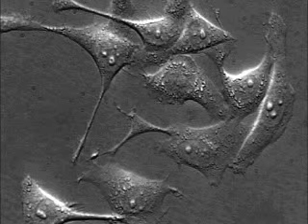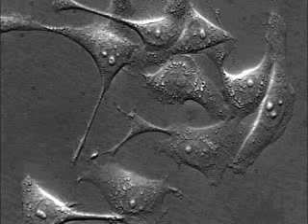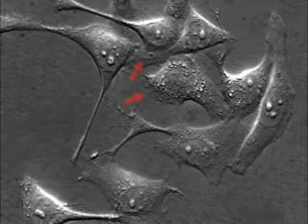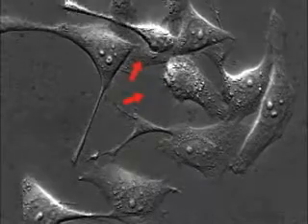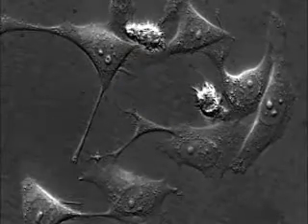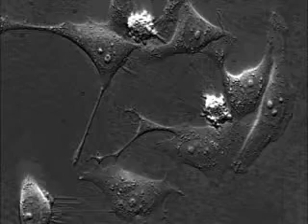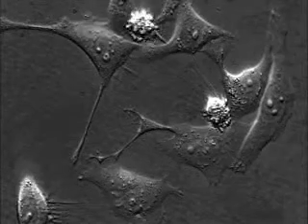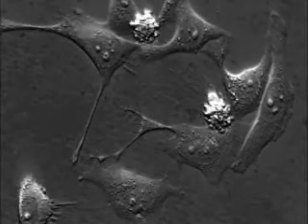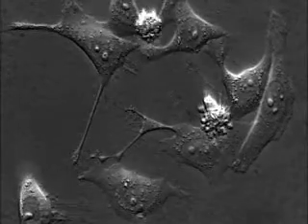Programmed cell death, or apoptosis, has been induced in these cultured cells. Cell death is characterized by blebbing of the plasma membrane and fragmentation of the nuclei. Suddenly, cells lose all attachment to the substratum that they have been growing on and shrivel up without lysing.